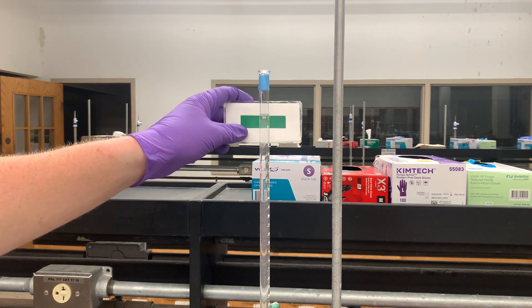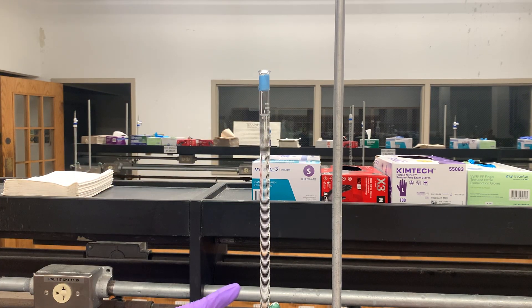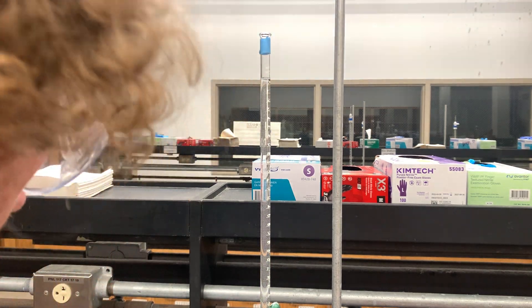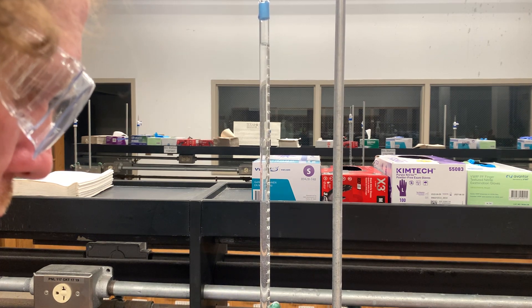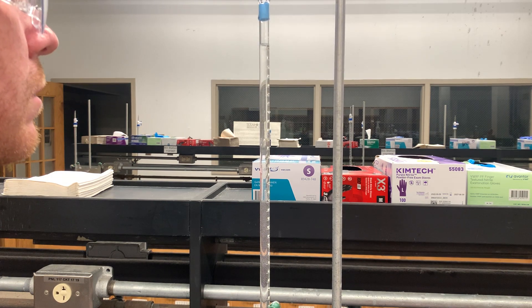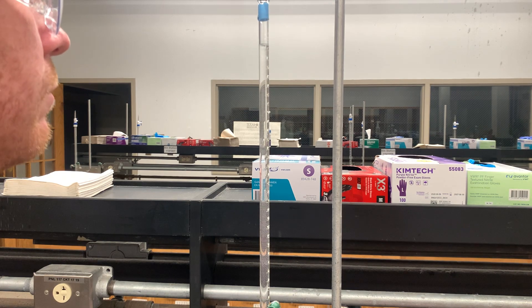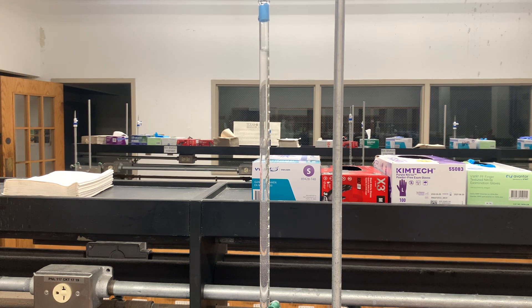I'm going to hold my green piece of paper up, and then I can see I've added too much sodium hydroxide. So I'll adjust my glassware, and then put a vessel below my burette to catch the solution. I'm just going to open the valve a little bit to let some of my sodium hydroxide flow through. And there we go — I got it exactly to 0.0 milliliters. I'm good.